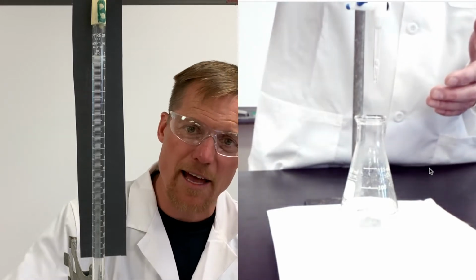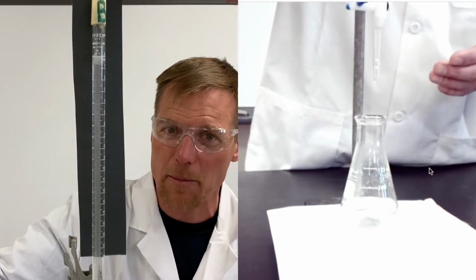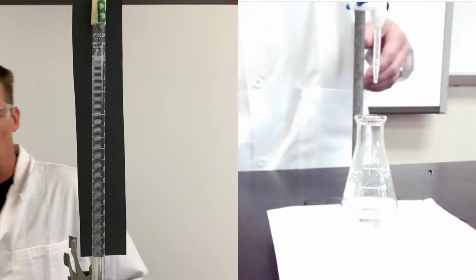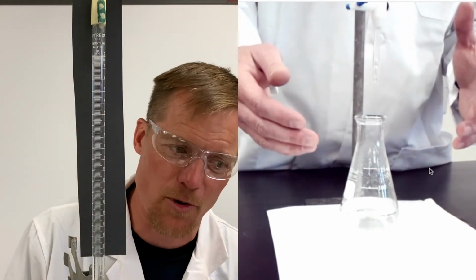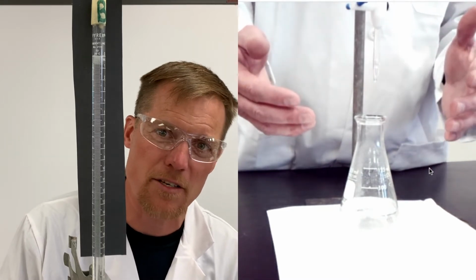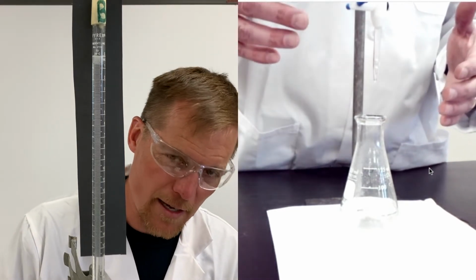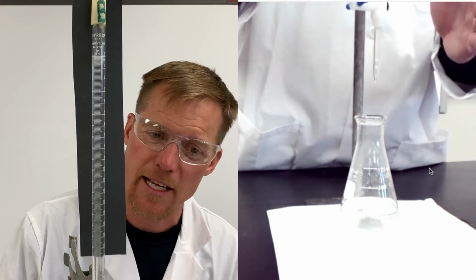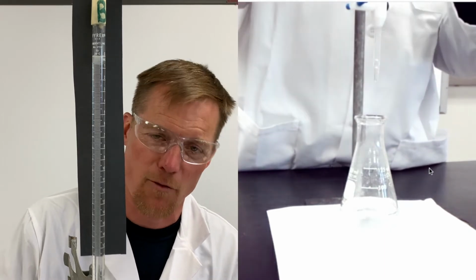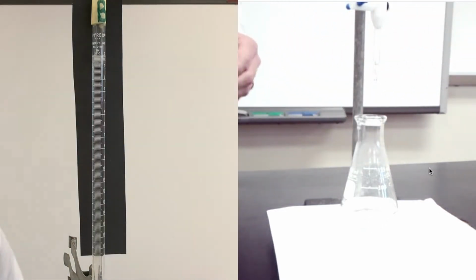But because we have sodium hydroxide that's a little bit more concentrated, I'm probably gonna need to use less when we titrate. So the first titration is always kind of a test run, all right? We're gonna shoot on down, maybe throw about 7 to 10 milliliters in there pretty quick. We're gonna get some color change, and then we're going to see when we finally reach that endpoint. It's okay if you mess up on this first one and overshoot. It's really just to give you an idea of where you're at for the next few trials that you run. Let's give it a try.